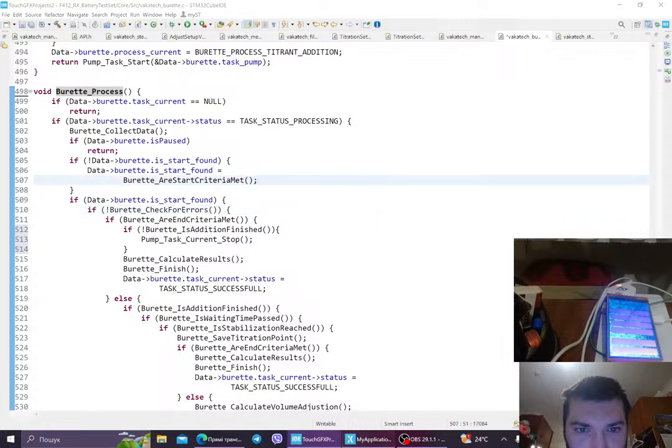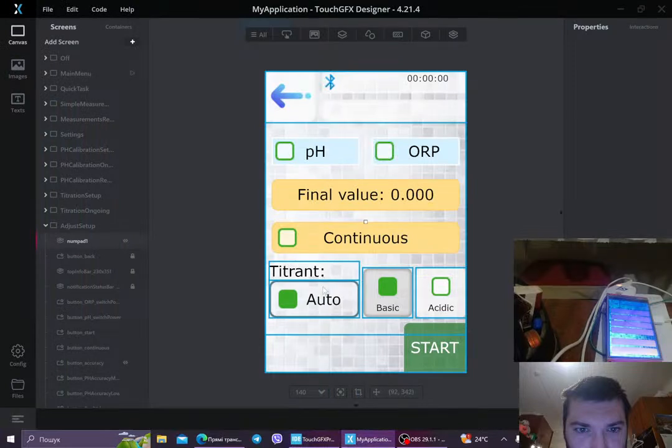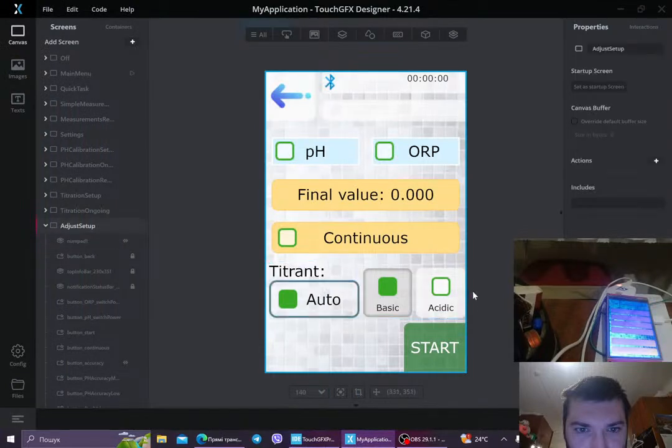And what was the problem? So go in here, let's see what we can do. Our task for today is the following. So the user should be able to show what is the titrant.